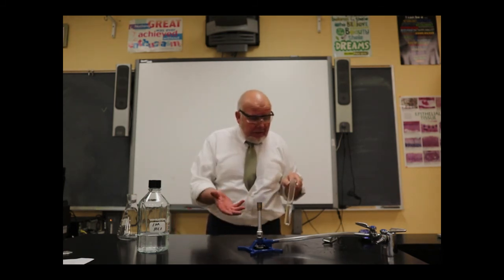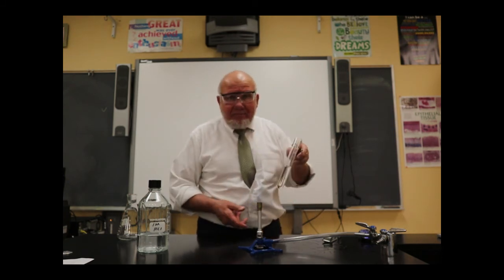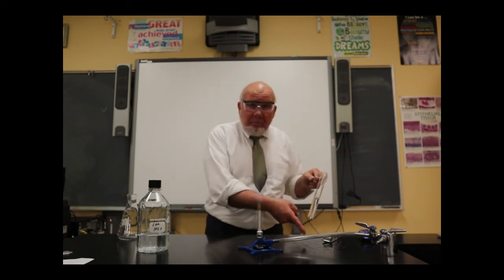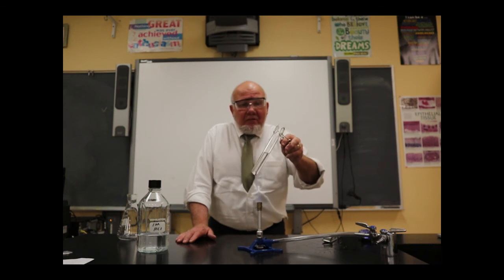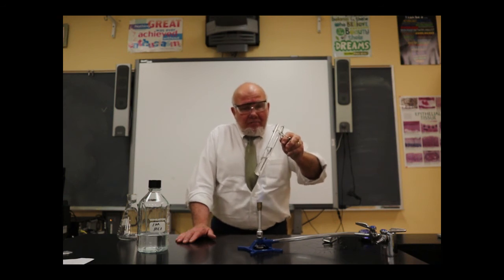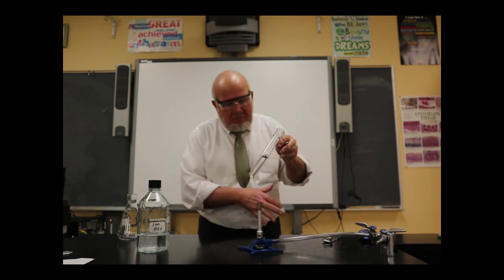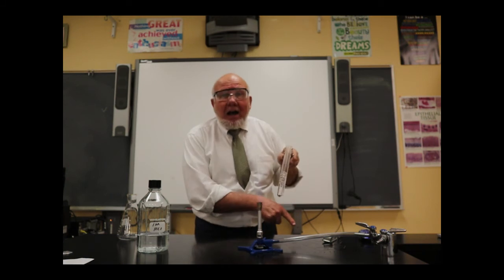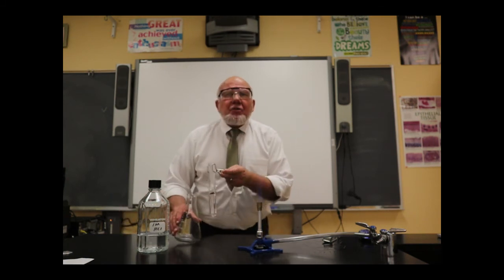And in essence, our experiment has kind of gone down the tube. Well, actually, it came out of the tube. Because it's a bunch right here. So I've lost a bunch. So obviously, this is going to affect my final bit. So in essence, what I'd like to do is speed up this process, because we've already ruined the experiment by the fact that I had some splash out, is let's boil off just a little bit there.